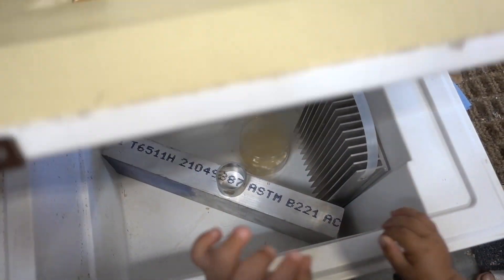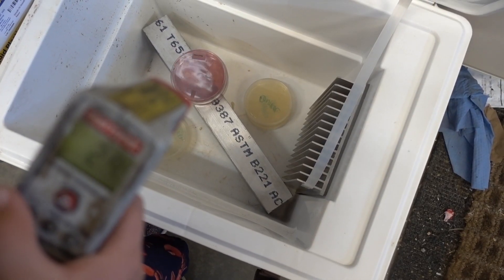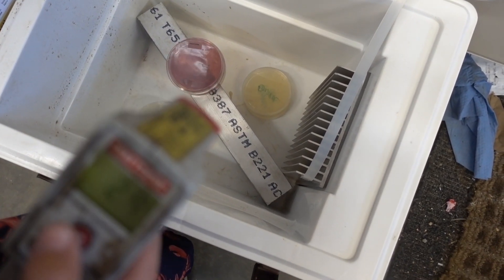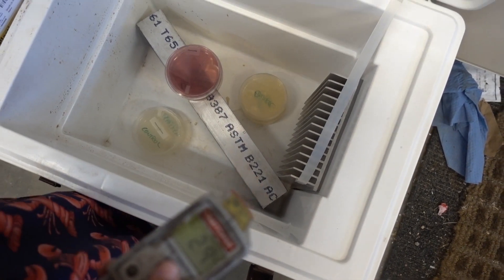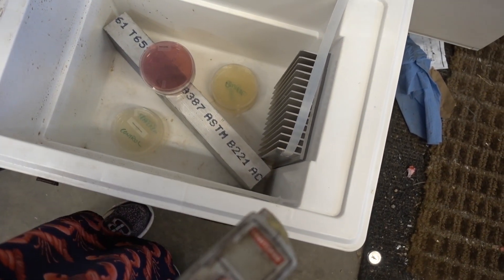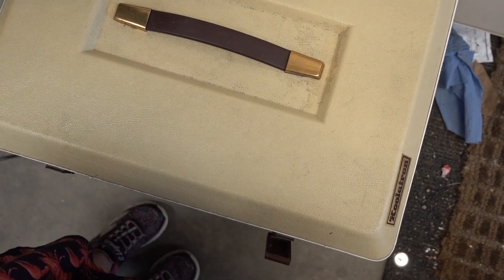We're going to put it in the incubator upside down so we won't ruin it. It's hot in there. Now what's the temperature? 29.